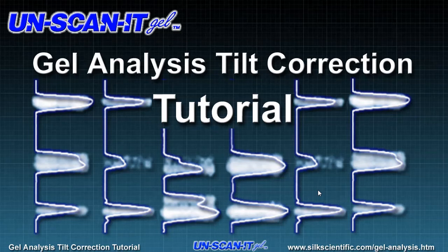This tutorial will focus on making some basic image modifications to correct for tilted gel images, which can then be analyzed using the Unscan It Gel software. In this tutorial video, we will skip the general steps in using the Unscan It Gel software and will focus only on the steps involved in correcting for tilted gel images. General stepwise instructions on using the Unscan It Gel software can be found in other videos on the Silk Scientific channel or at our website at silkscientific.com.